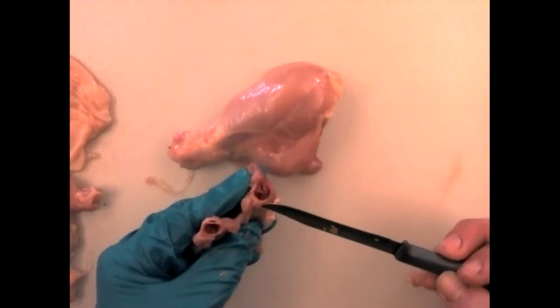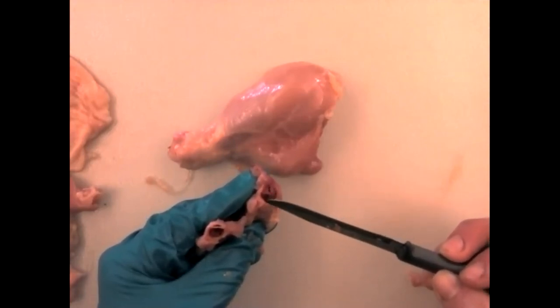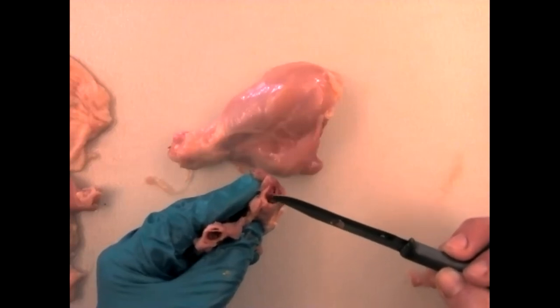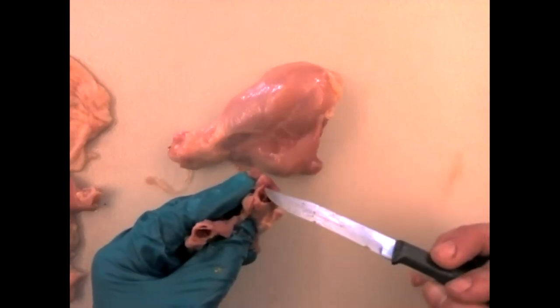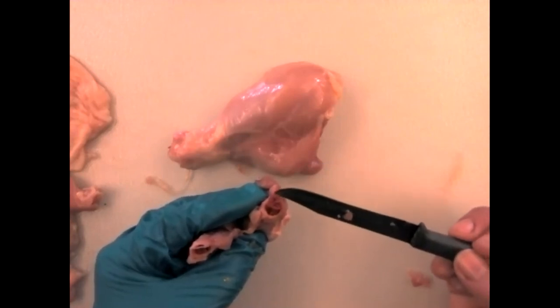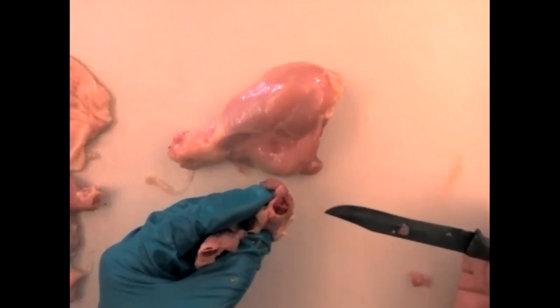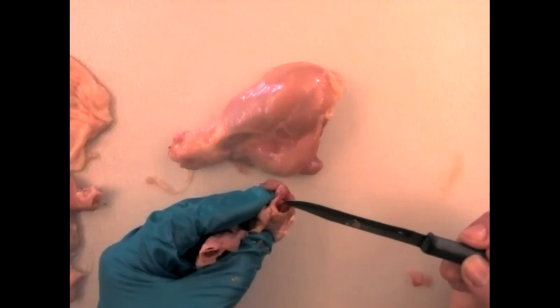This is the bone marrow. We can see the compact bone shell on the outside. Even though it's red, when I run my knife along this structure it feels like bone — this is spongy bone filled with red bone marrow. The spongy bone here and the medullary cavity are filled with gooey red bone marrow. When you are first growing, you do not have yellow marrow in your medullary cavity — it's full of red bone marrow. This will be replaced by yellow marrow as soon as you're done growing.